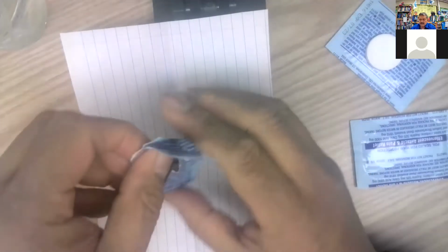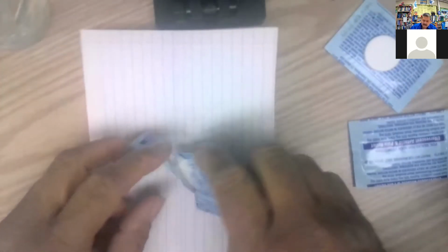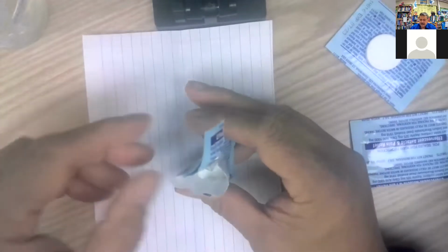Some smaller pieces already. Like that. Let's see how well this coffee mug's going to work. Turn your volume down. Here we go. Right, that's pretty good, right? In fact, there's some coming out the edge of that. So I'm gonna take this, just looking there. Yeah, pretty fine powders, right?